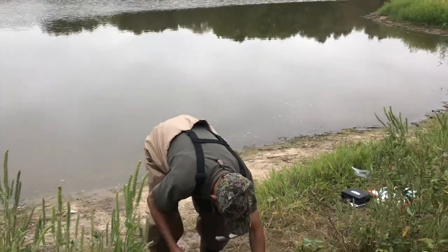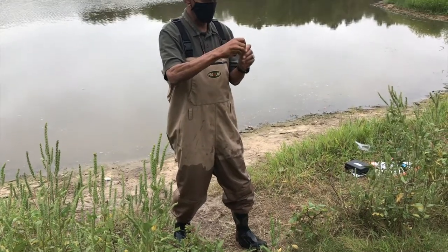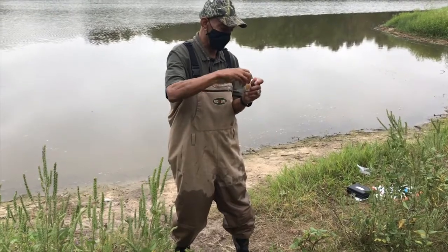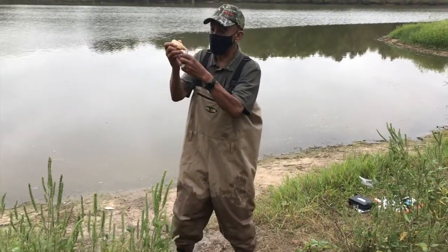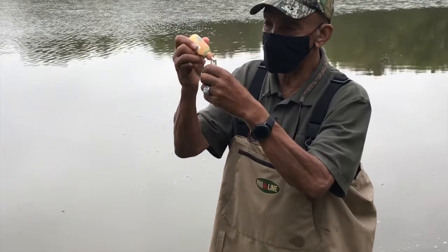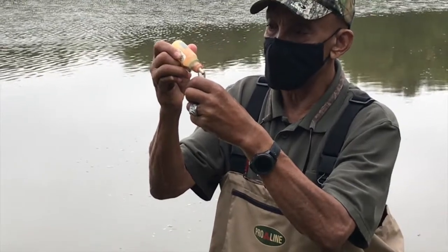The next step is to add a reagent called wide range indicator. And once we add that, we should see a color change. The magic number is 10 drops. So I'm going to drop 10 drops of this reagent. 1, 2, 3, 4, 5, 6, 7, 8, 9, 10.